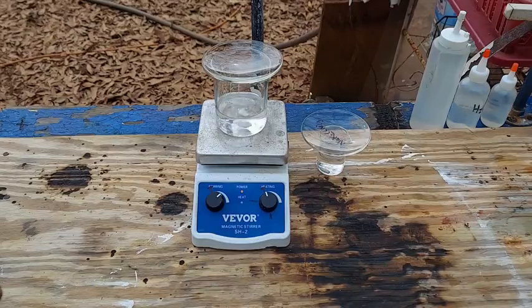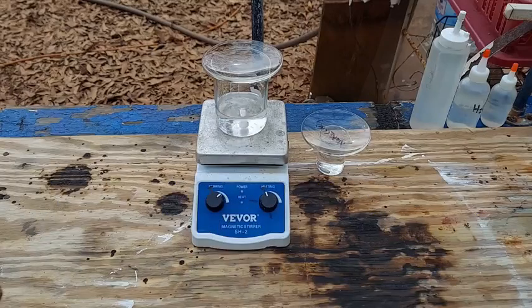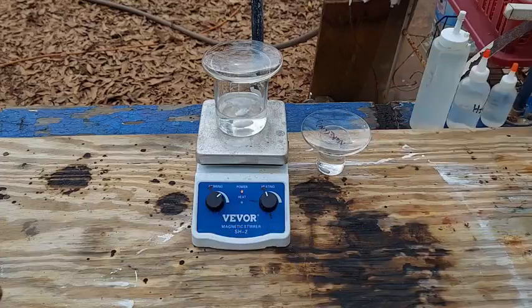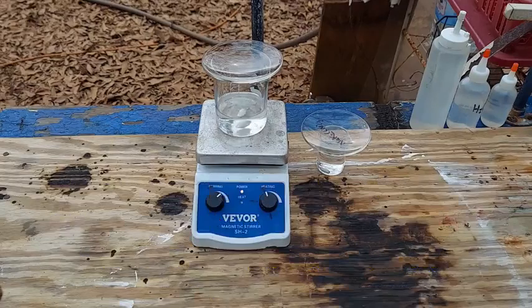Now obviously this is a very dangerous compound. It is water soluble - it's full of cyanide, and if the cyanide doesn't kill you now the thallium will kill you later. It may absorb through the skin like other thallium compounds. Will the cyanide absorb as well? Who knows? There's not much info out there about this compound at all, and if it wasn't for Atomistry I wouldn't even know that it would be possible to make it this way.